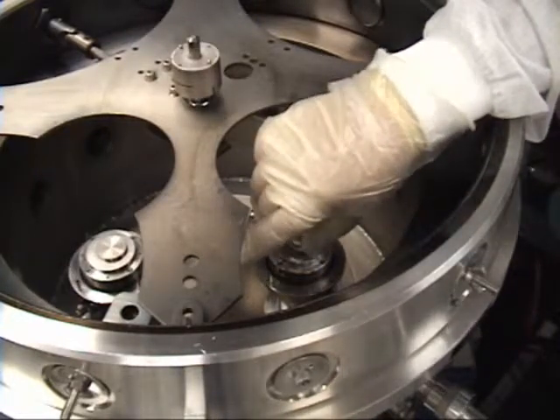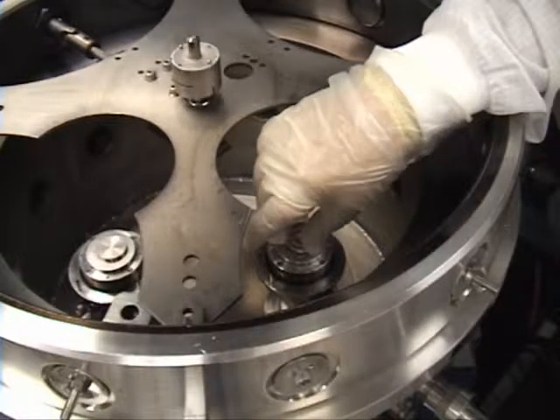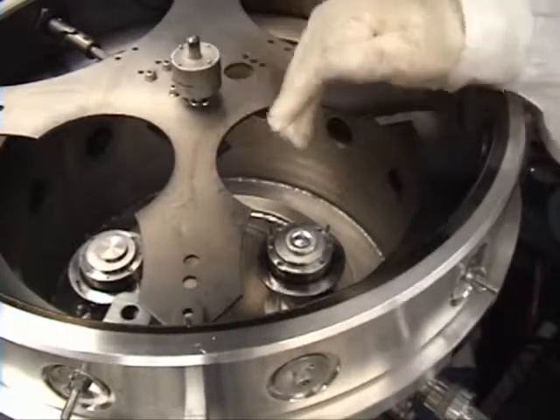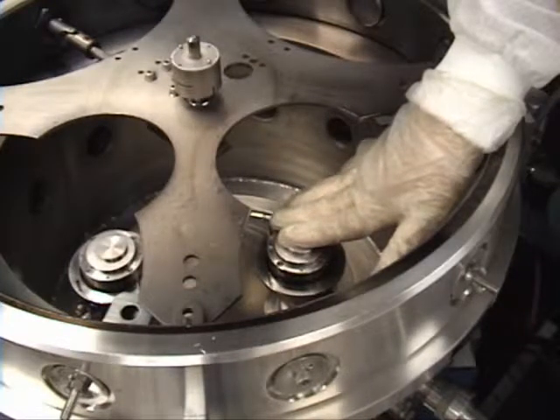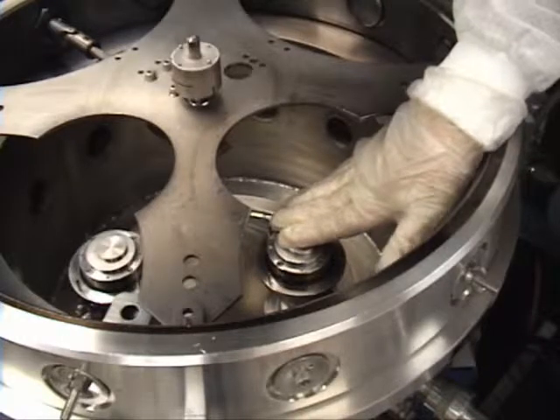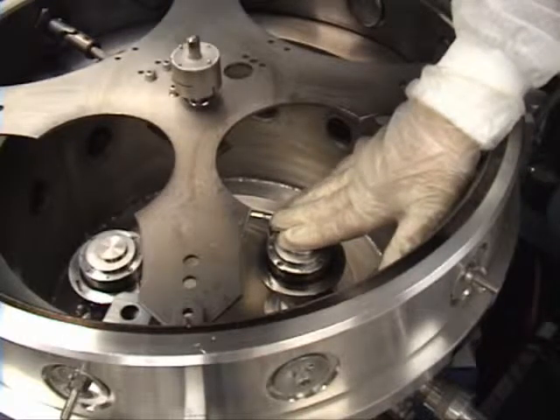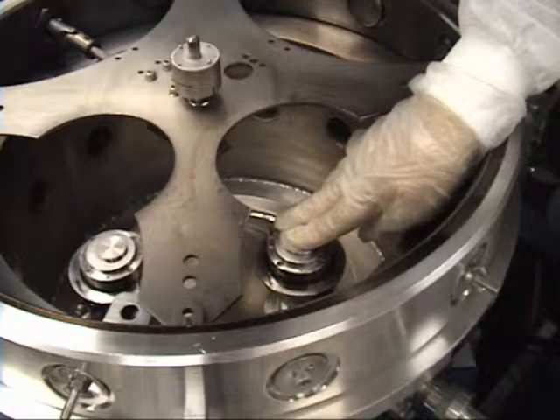You're going to try to center your target right in the middle of your magnetic table. Once you drop it, you're going to apply a little bit of pressure and move this target slightly just to make sure you have a flat amount of silver paste. Because if it's too thick on one side, you're going to cause a short.